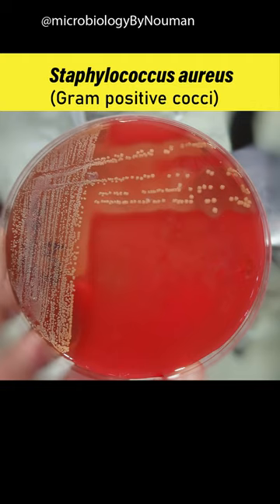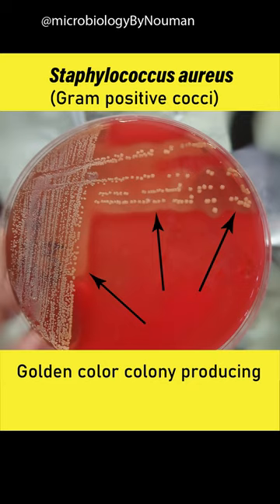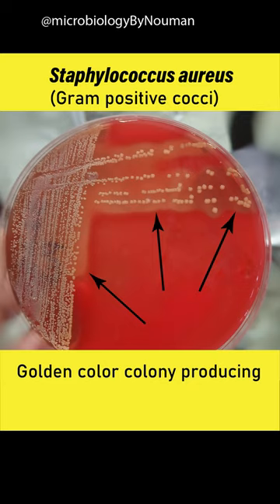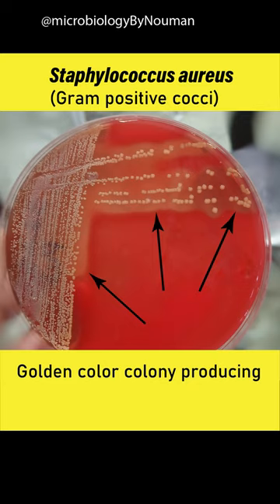Staphylococcus aureus is a gram-positive cocci and produces a golden color colony on agar, a yellow pigment known as Staphyloxanthin.